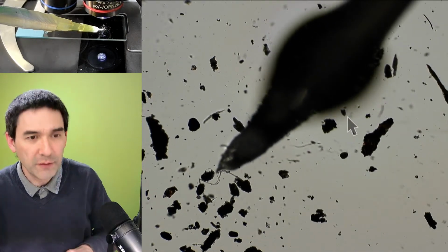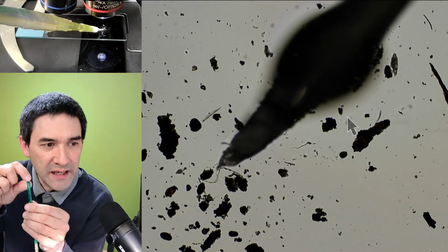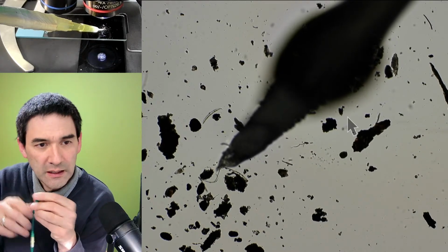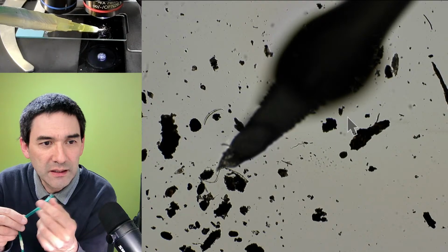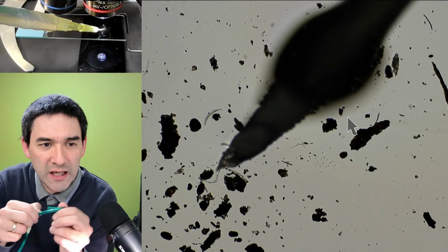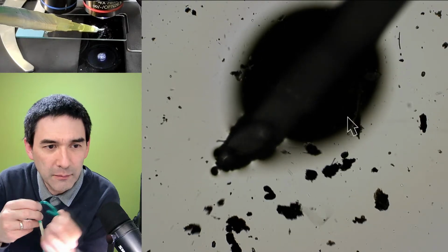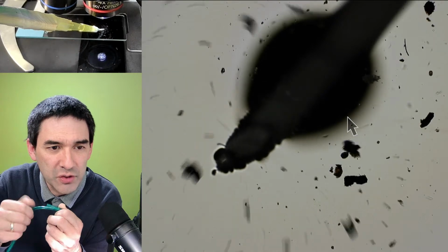And the idea was the following. The idea was to seal off this end of the tube very tightly, and then by trying to bend it, you're able to somehow change the volume. You have to press it, and this way you're able to suck it in somehow.